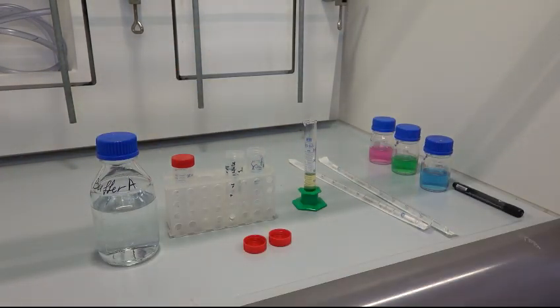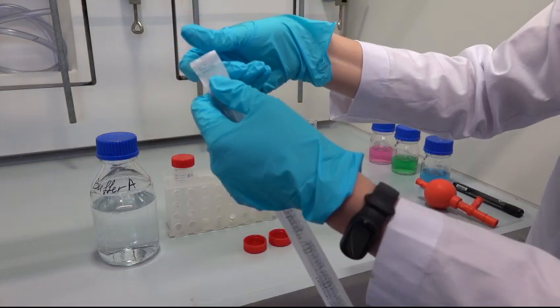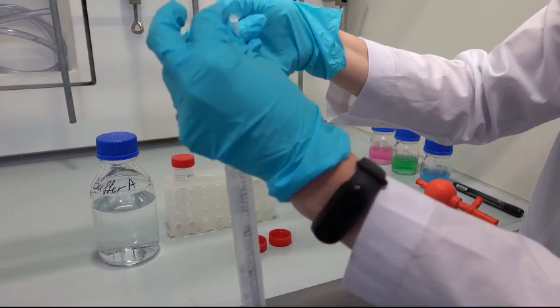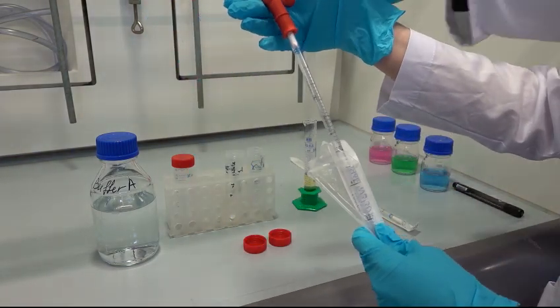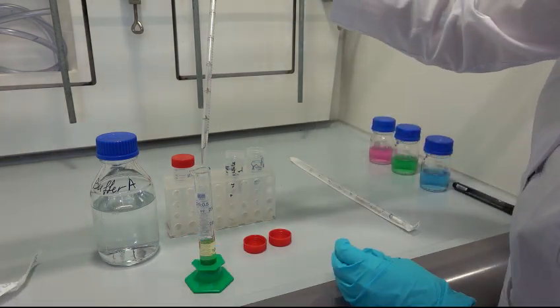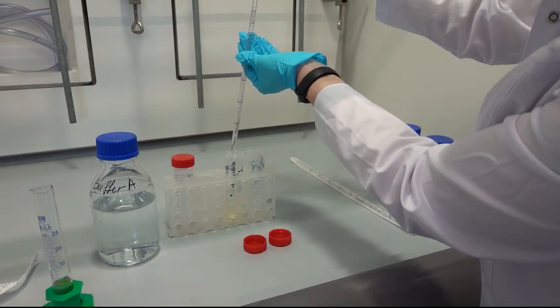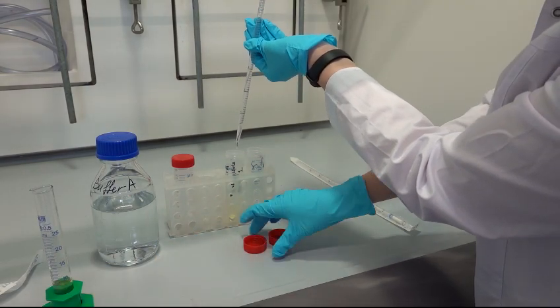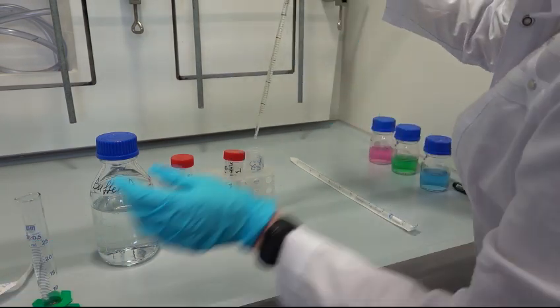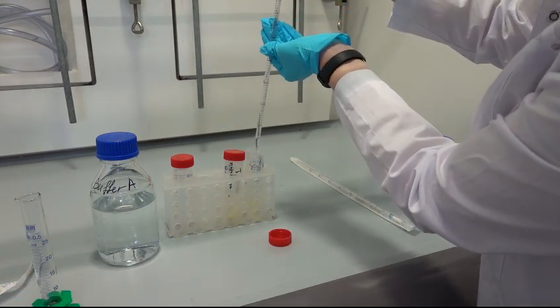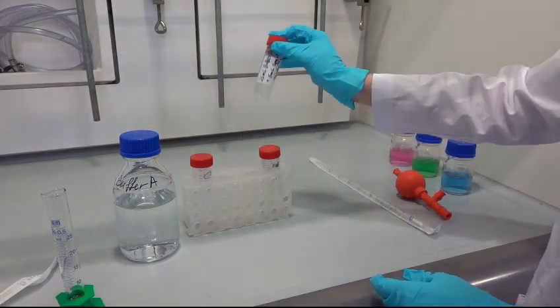The same procedure should be repeated for the egg white, this time using a serological pipette to avoid contamination. Close all the tubes and don't forget to clean the work area.